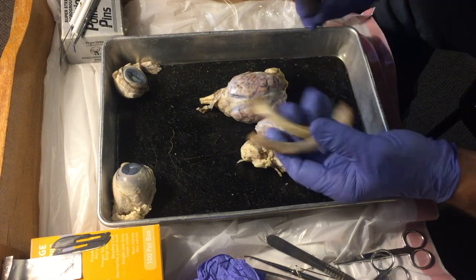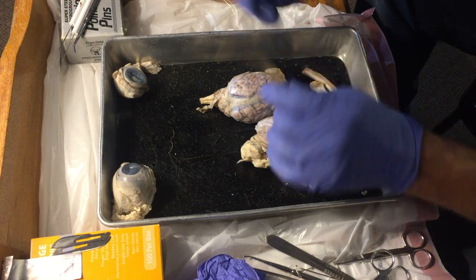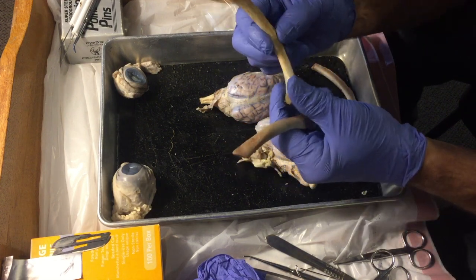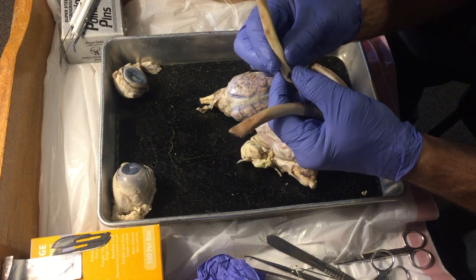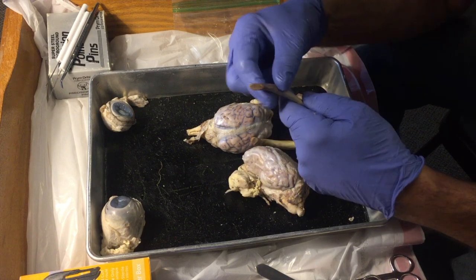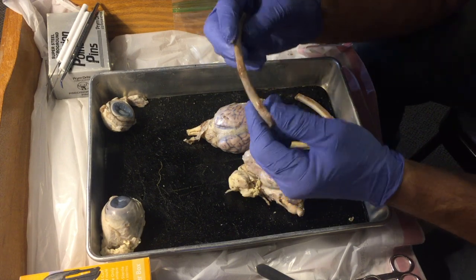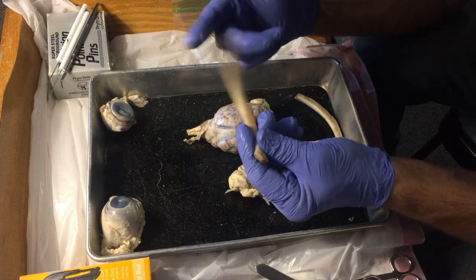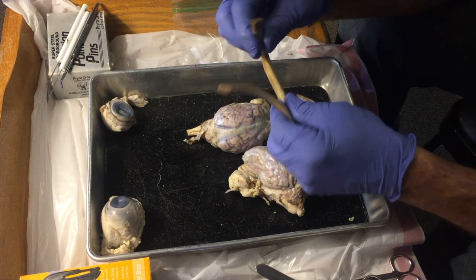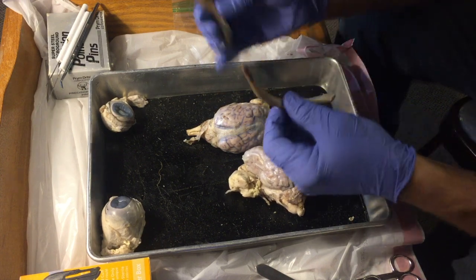Let's see if this one's a little rubberier. Okay, so what we did, taking this bone and soaking it in 10% hydrochloric acid, we dissolved away the calcium phosphate part of the bone and left just the collagen part, which is the flexible part. So it's the same bone, just missing that calcium phosphate part. And so that does a good job, I think, of illustrating the difference between, well, I mean, I could break it, but it would splinter.